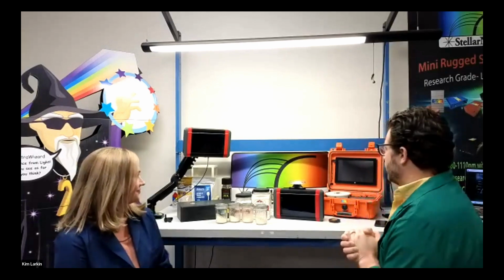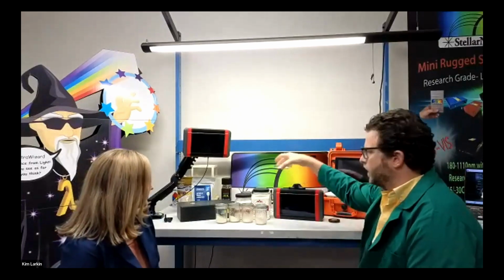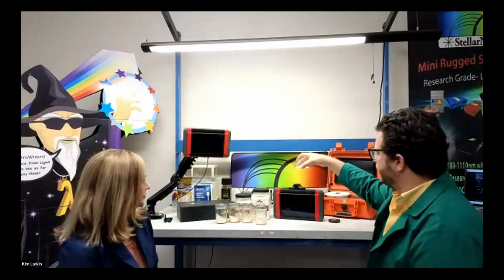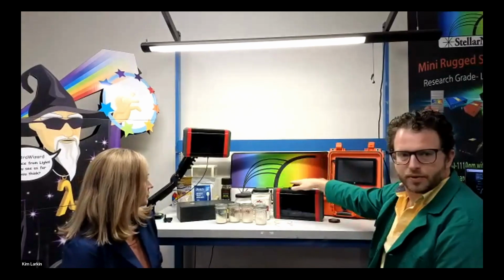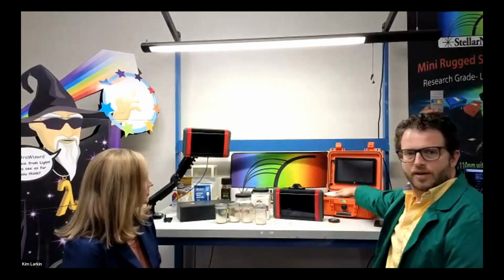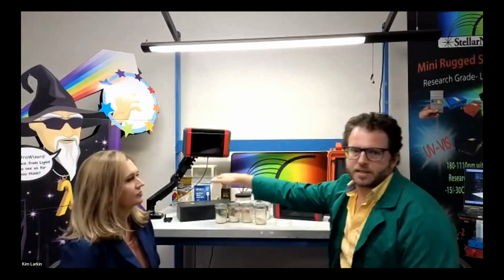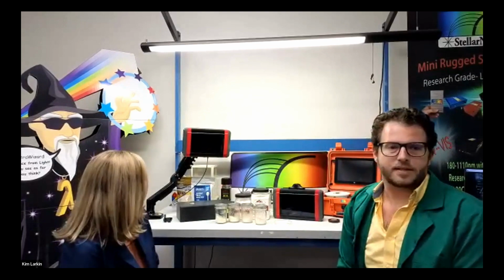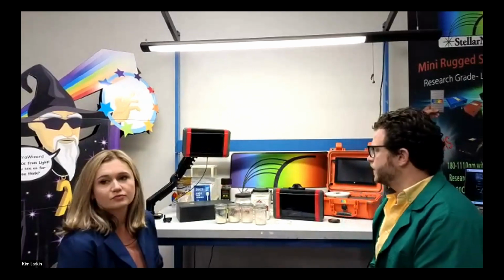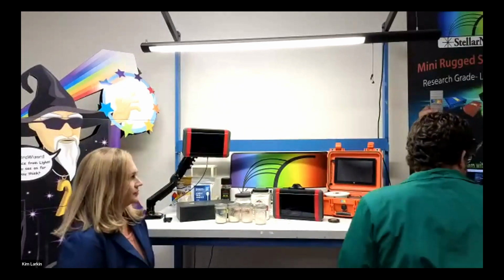So without further ado, I'll share my screen. And then when we take a measurement, Kim is actually going to put the check sample onto the fixture here. This is the reflectance fixture head for the handheld. This is the fixture head for the case system. And then this is our industrial process fixture. We also have probes and other process accessories if that interests you.